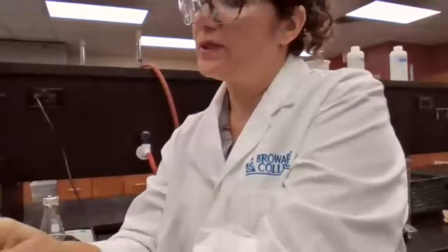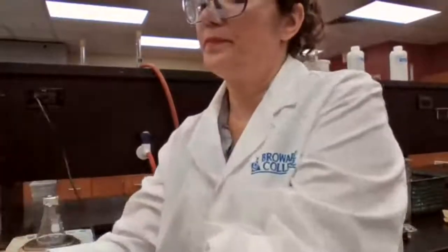So just want to make sure the water bath temperature is 95 degrees Celsius, for first try and second try.